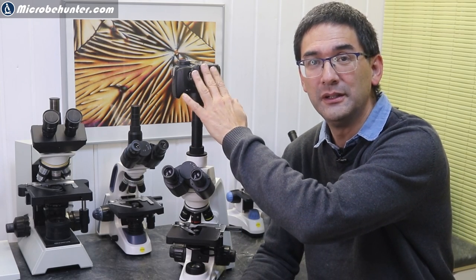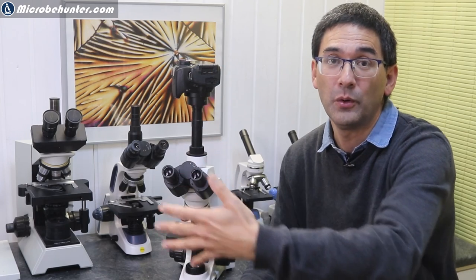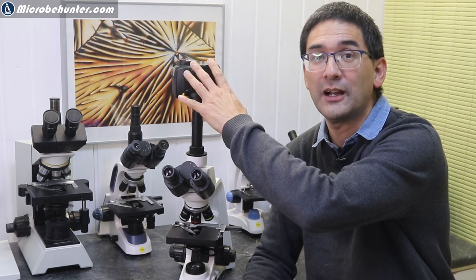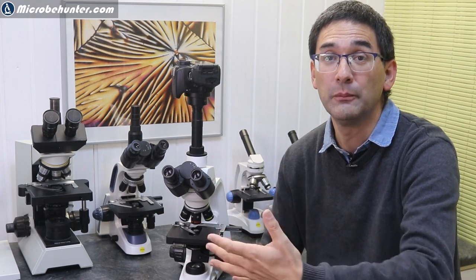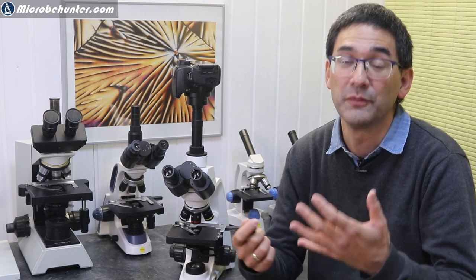Now, how do you actually get the signal from a camera directly onto a computer screen so that you can do some live microscopy? You don't have to look through the eyepieces — you can watch what you want to see on a computer screen or monitor. More people can watch as well, which is a big advantage in an educational setting. It's also more convenient because the camera displays exactly what you're going to film or photograph, so you can do all adjustments and focusing on screen, then simply press the shutter release to take a picture or video.